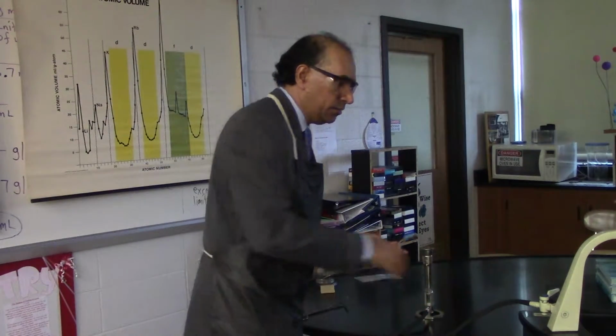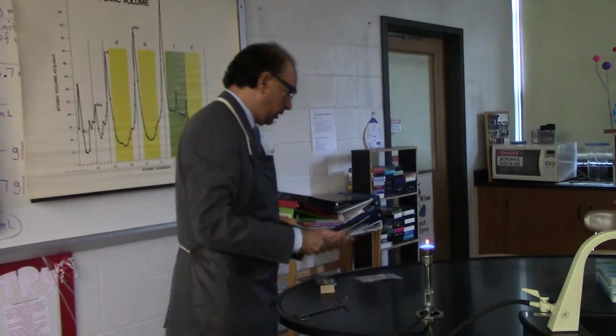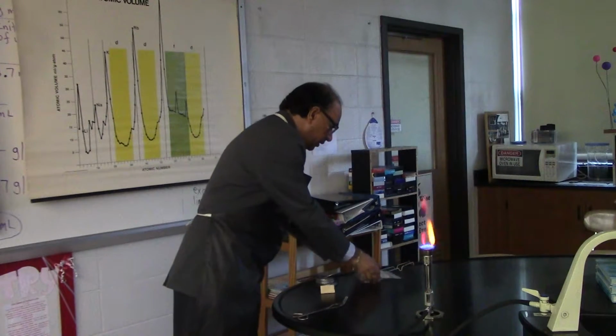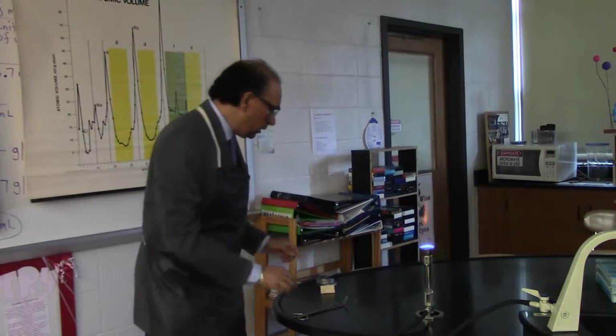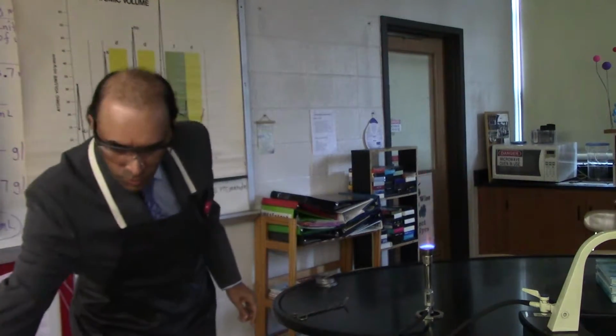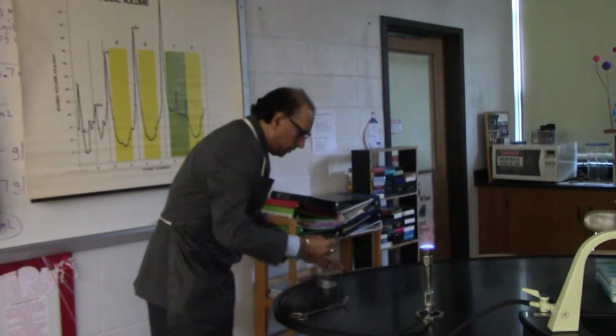I have my burner over here. We'll go ahead and light the burner. Okay, so we have the burner. I'll move this away and move my sandpaper away. Here we go. We'll take a piece of magnesium ribbon.